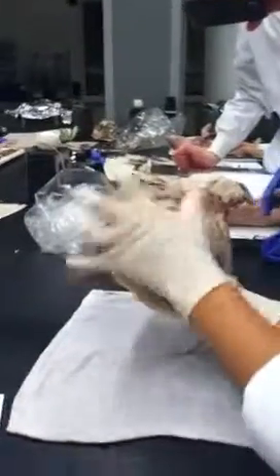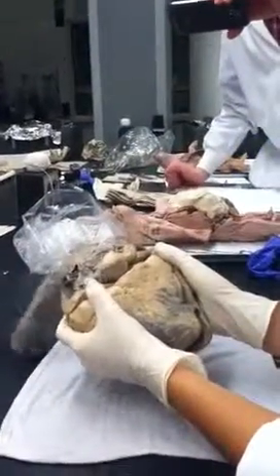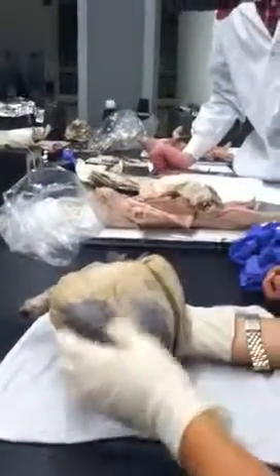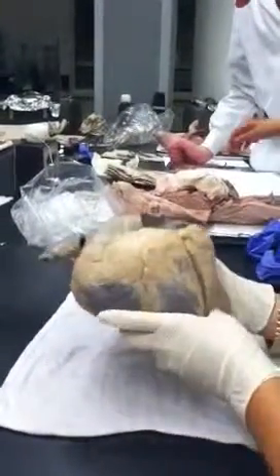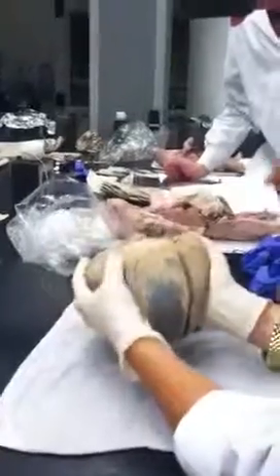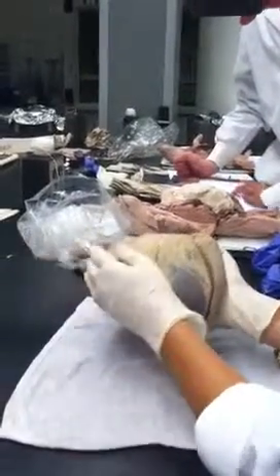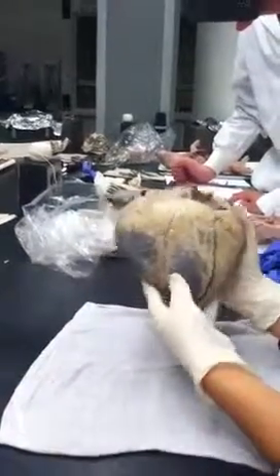Coronary sinus, then left is left and right is right. Okay? And if you don't see the coronary sinus, then left is right and right is left. Okay? So what side is this? The right. Good. Yeah. This would be the right side. This would be the left side.